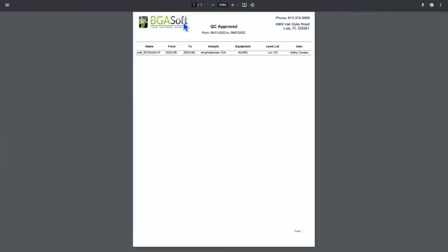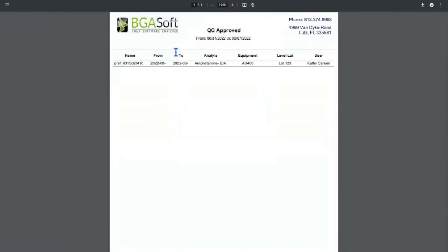I don't know why this logo is still there. This is an older report, but this gives you the approval: who approved, what QCs were approved for your instrument and when, right? So you can make sure that you have an approval for every month. This is kind of validating that you've approved everything.